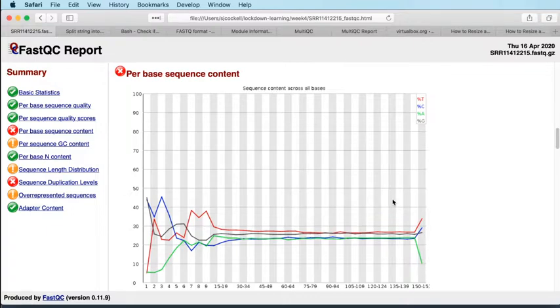But that's not what we've done here in this experiment. We've not sequenced the genome, we've sequenced the transcriptome, but also the way that our fragments have been generated is also not entirely random. So when you produce your cDNA, your first strand cDNA from your fragments of messenger RNA, in order to prime that reverse transcription reaction, the standard library prep methods use random hexamers to try and prevent introducing any bias in mRNAs that are more or less likely to get converted into cDNA. Turns out that process of random priming is not entirely random, and that's what's being exhibited in the first dozen or so bases in this data. So we're not seeing parallel lines because we're seeing the pattern of bias in that random hexamer priming.